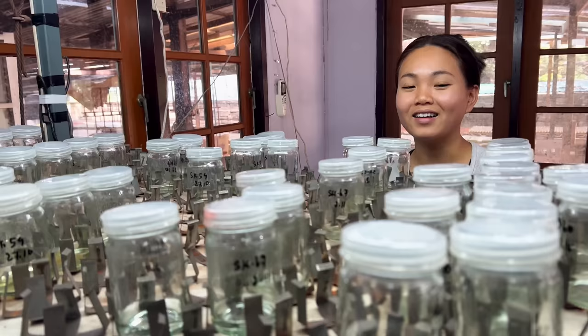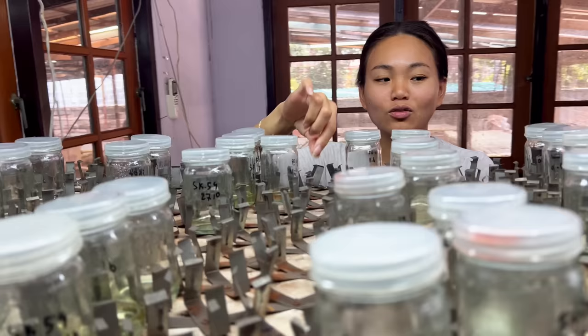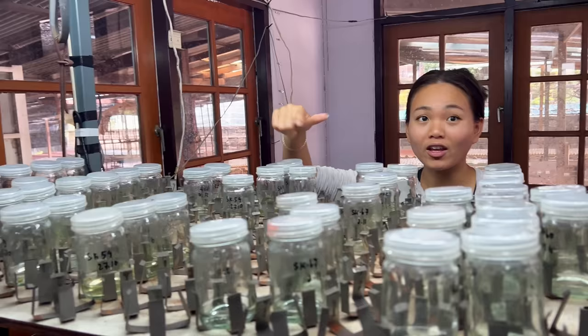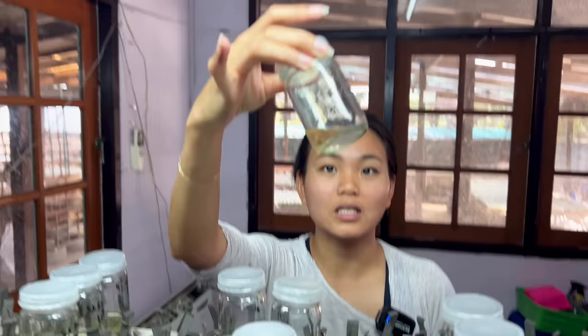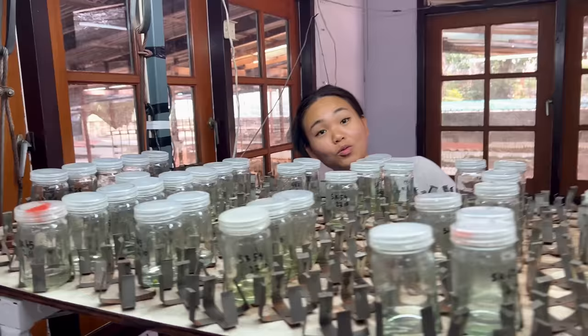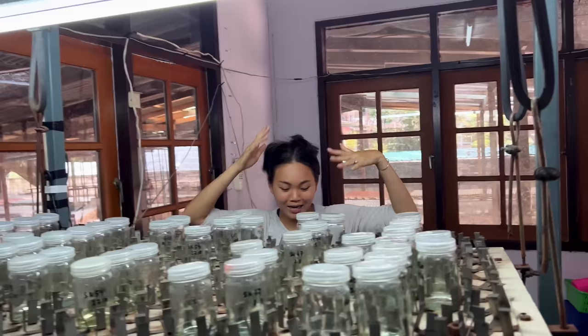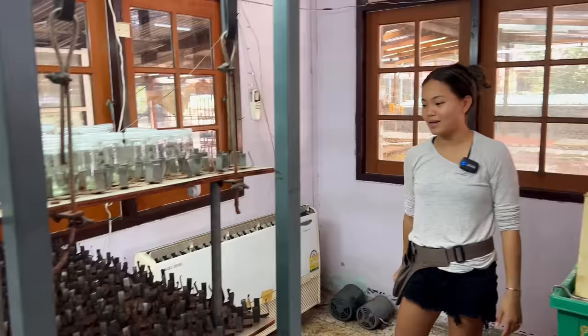Once we take the shoot, we get the cell. We keep this on shaking 24/7 to sterilize. Then we have to come and look at it daily. This one is kind of pinkish — it might go back soon. We change it, new solution, keep it shaking 24/7 until we see growth. This looks like a yoga band or something. My dad created this — he used his own DIY approach and created this shaker. That's why it looks kind of like yoga bands.